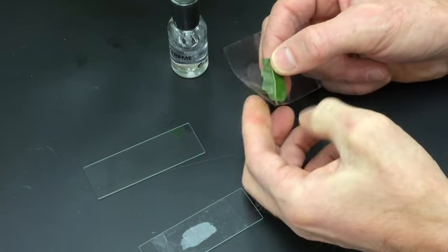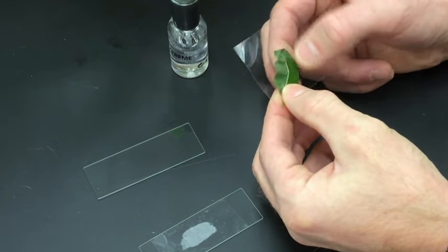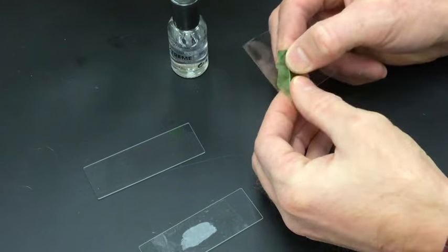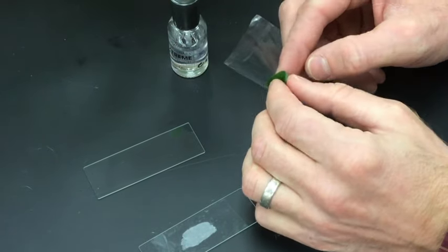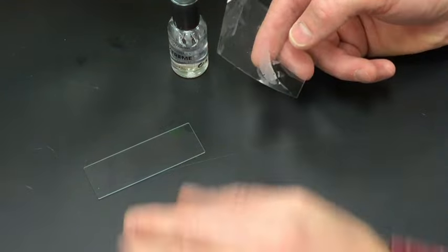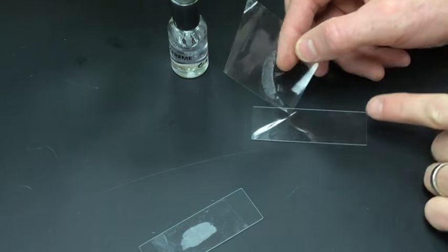Especially with the ficus plant, because it kind of curves. Try to remove any air bubbles. This is very sticky tape, so this ought to work pretty good. Yep. Same thing, I've got the impression there.